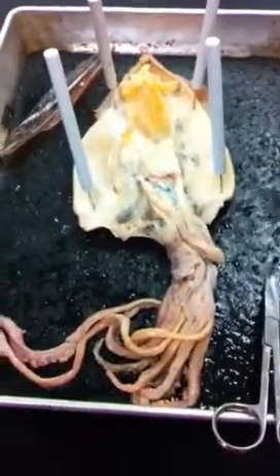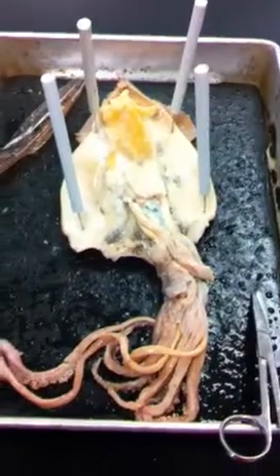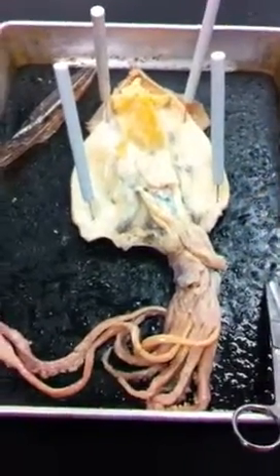The posterior is going to be the fin. Dorsal is going to be that flat side that it's laying on with the dark stripe. The ventral is the side that we cut on, which is kind of plain.